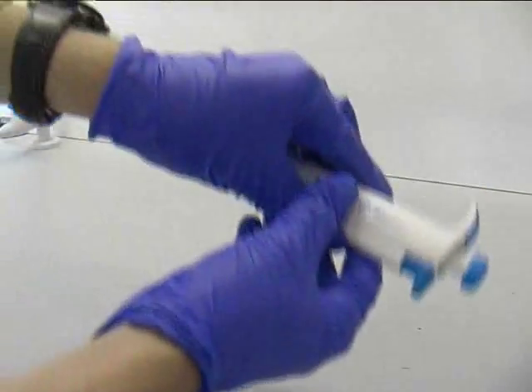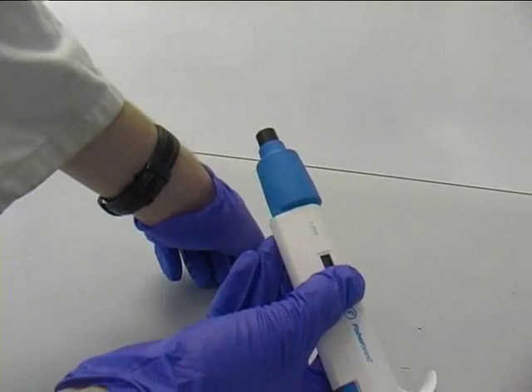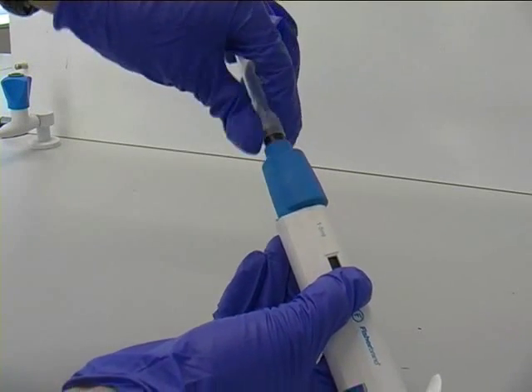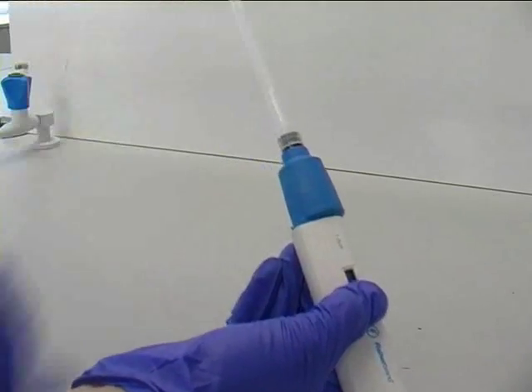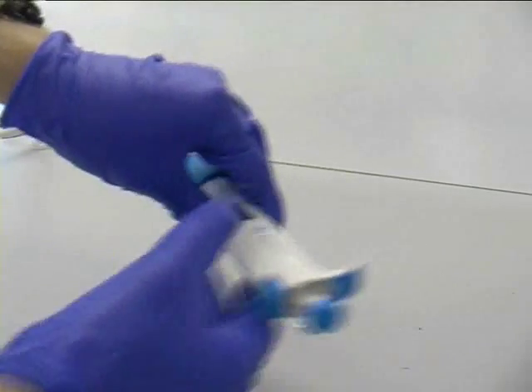The pipette tips are disposable and each tip should only be used when pipetting from the same solution or in rare occasions when pipetting from a series of sequential dilutions.